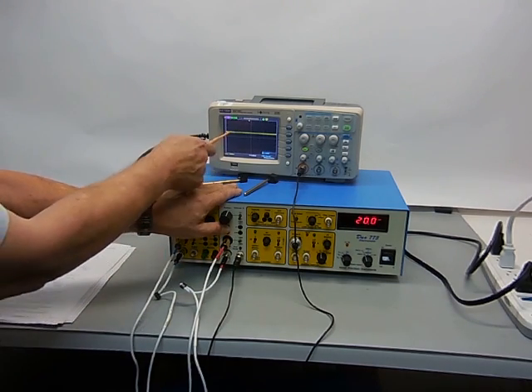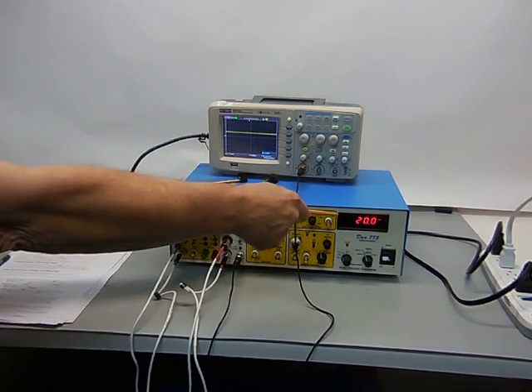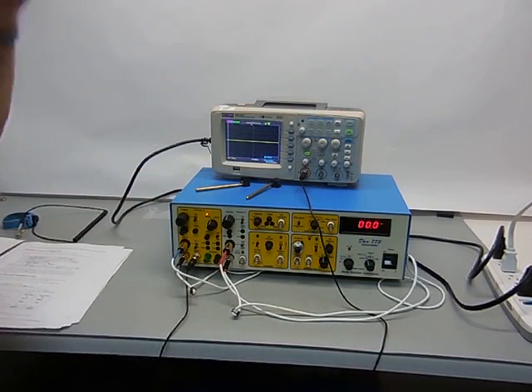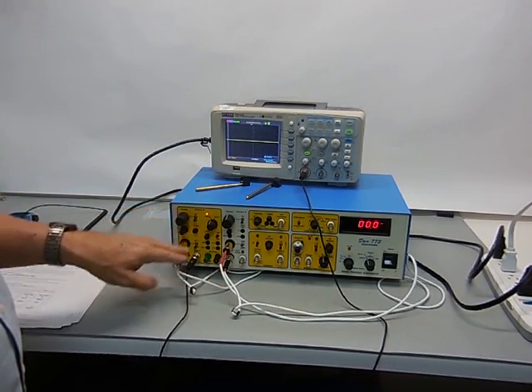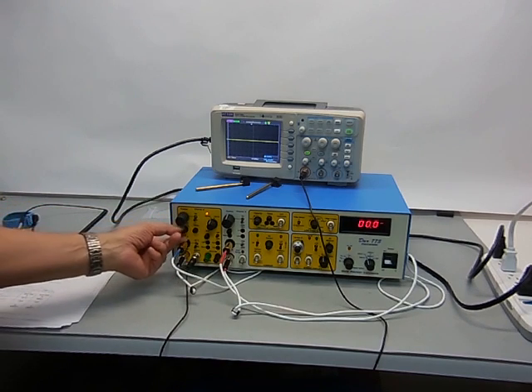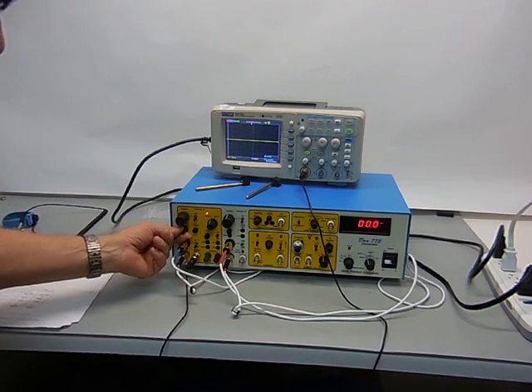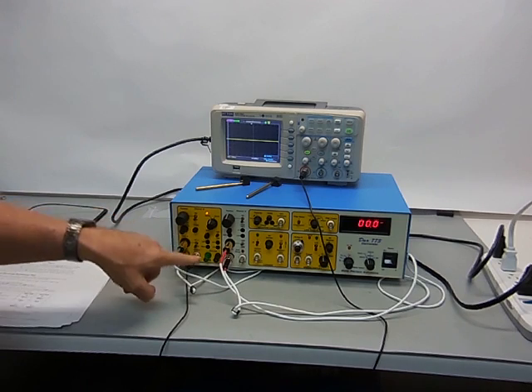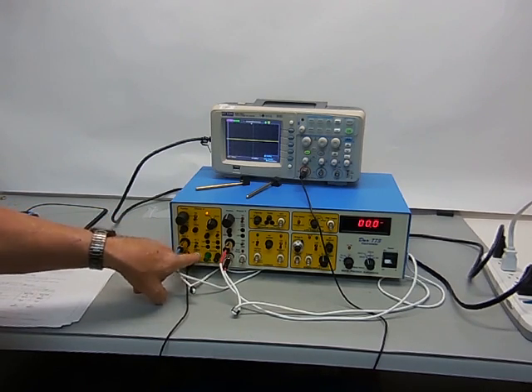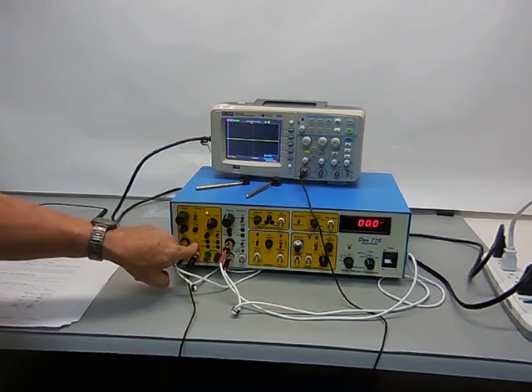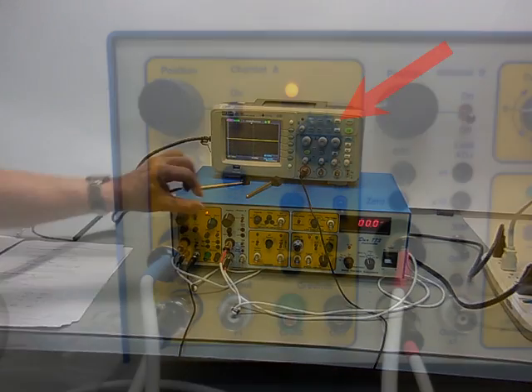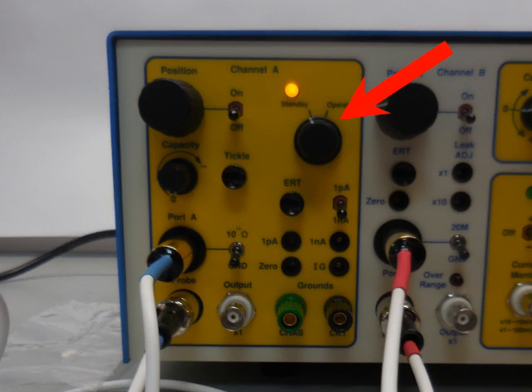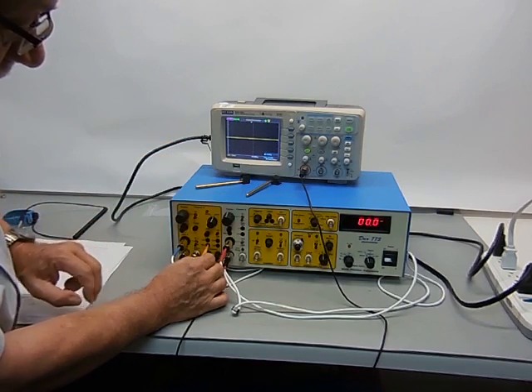If I press the ERT test button, I'm putting 1 nanoamp of current through a 20 megaohm resistor, and I should read 20 millivolts exactly. Now we're going to adjust the channel A offset positions. We're in standby, position switch is off, capacity compensation turned fully counterclockwise, probe is plugged in. I've got the output connected to the oscilloscope. First, turn the operate switch on. Step two is to adjust the zero position of the probe. I just got rid of the leading zero there.